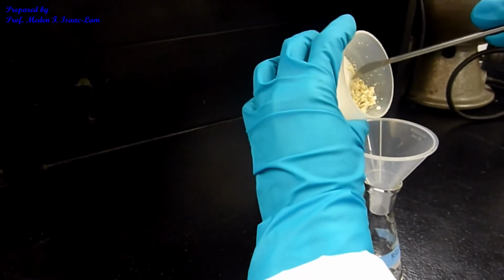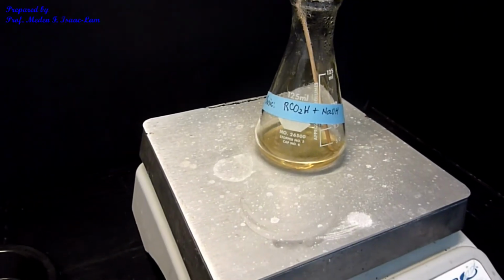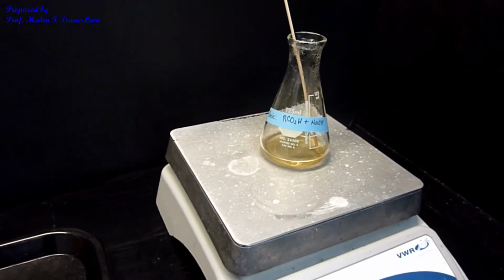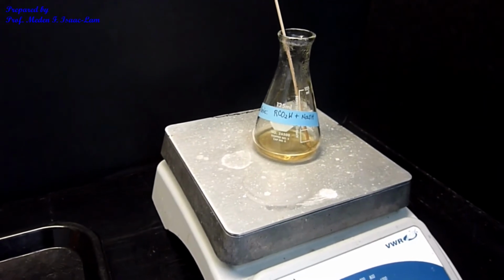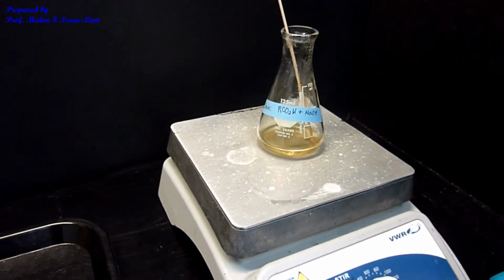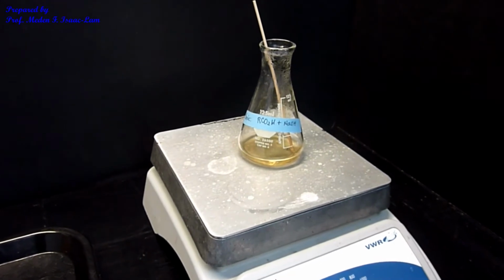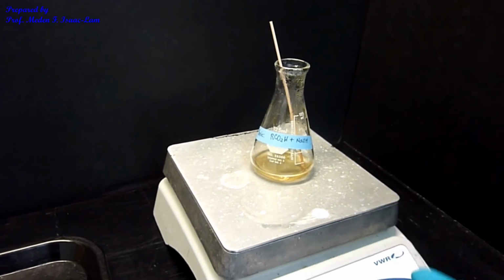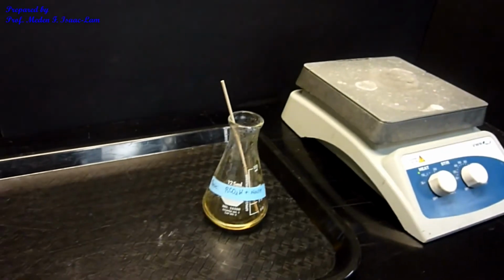I'm now transferring the sample into the e-flask so I can dissolve it. I added about 10 ml of water to recrystallize the carboxylic acid because the color is not entirely correct. So I decided to recrystallize it, and there really is nothing wrong with recrystallization because it will make the sample better when we do the melting point. Now it's dissolved, and I will let it cool at room temperature and then let it crystallize.